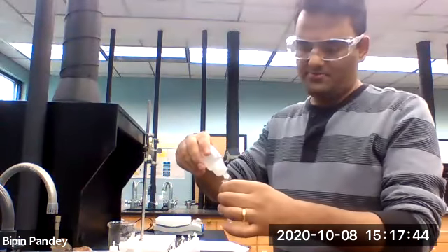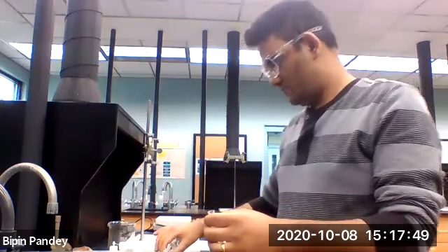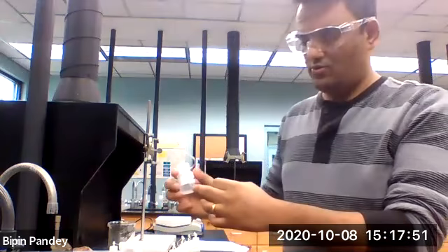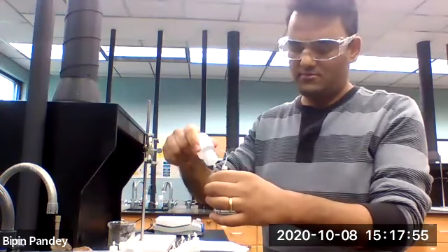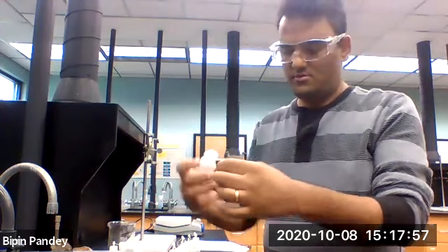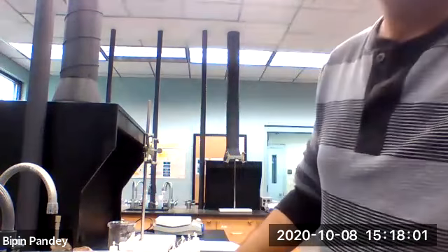I take 5 drops of sodium chloride. Add sodium bromide to it, 5 drops. Solution is clear, no reaction.